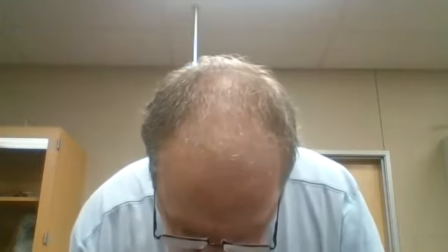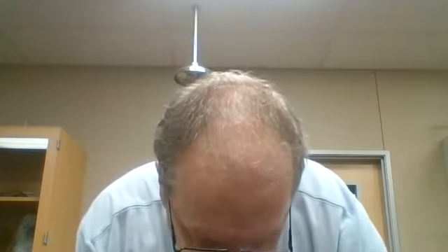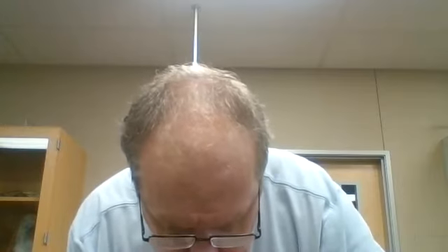Your zone size for tetracycline is very small. It grew right up to the disc, 7 millimeters. Your zone size for the next antibiotic disc, streptomycin, a little larger, 17 millimeters.